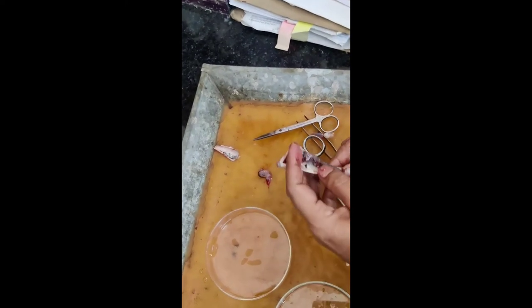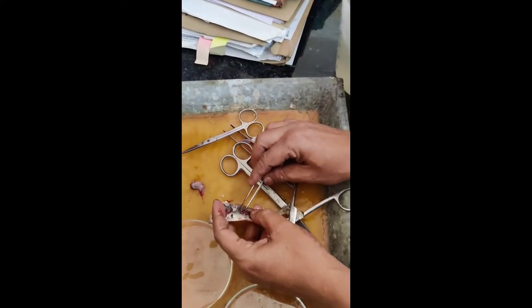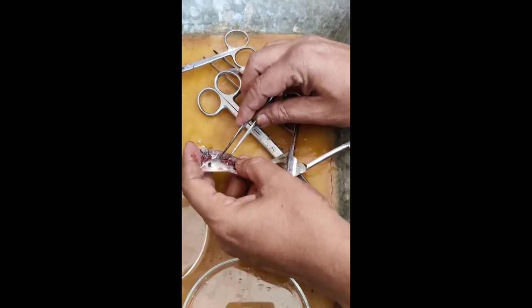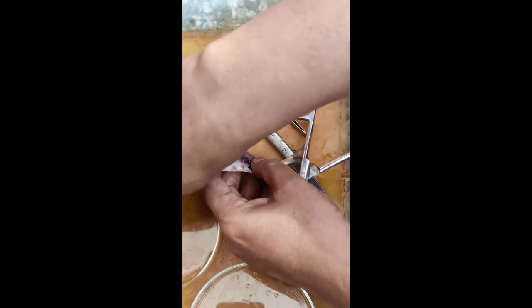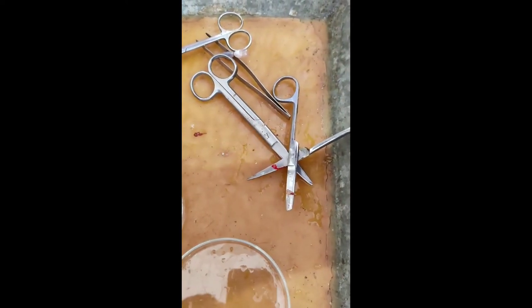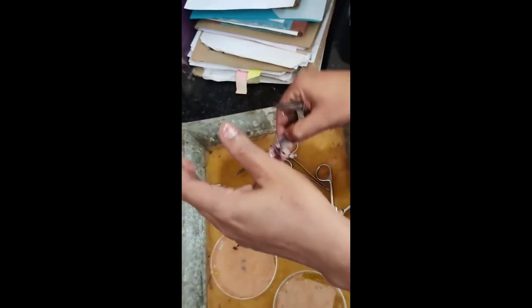This is the main organ where hematopoiesis takes place and all blood cell production occurs. Not only blood cells — if you talk about the stem cell portion of the head kidney, all of the cells are actually generated from this stem cell region. This is muscle part, now this is the organ — you can see, if you take it out, this is the entire kidney. Once I take out the kidney, it is already empty, attached to the vertebral column and muscle.